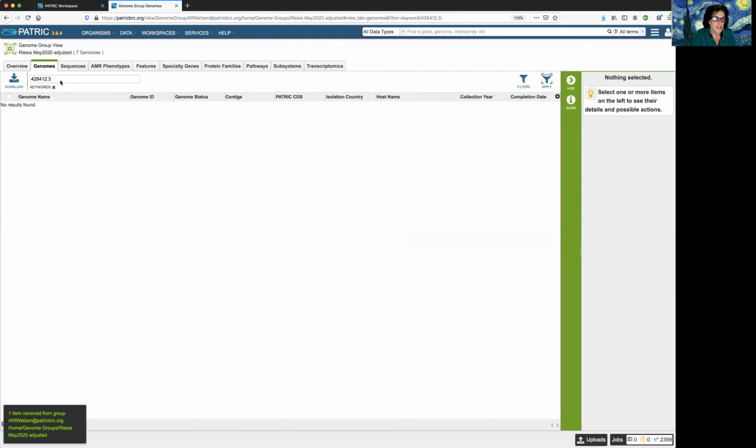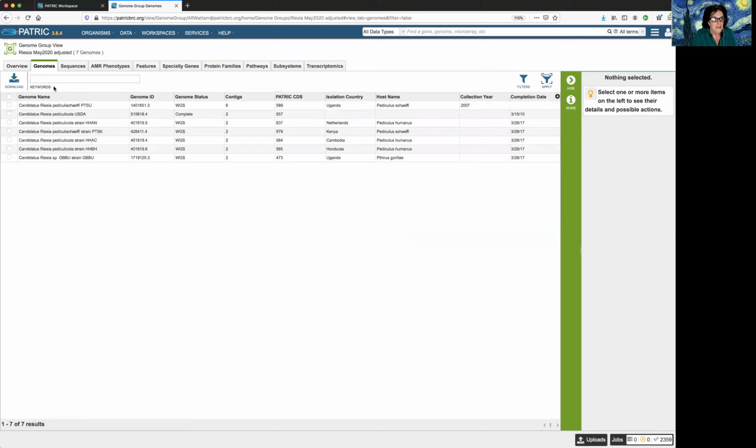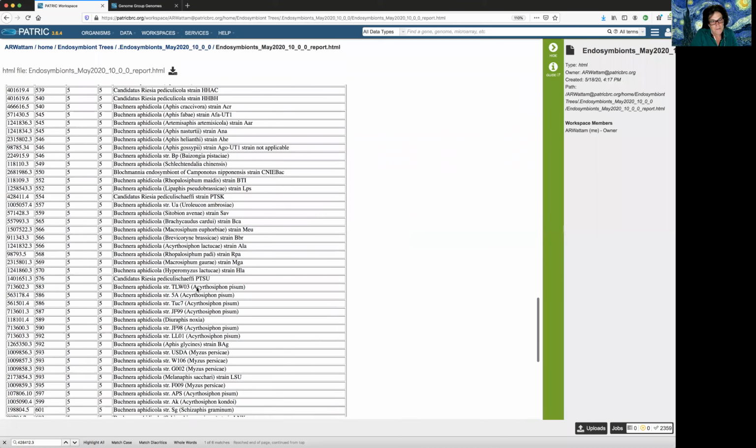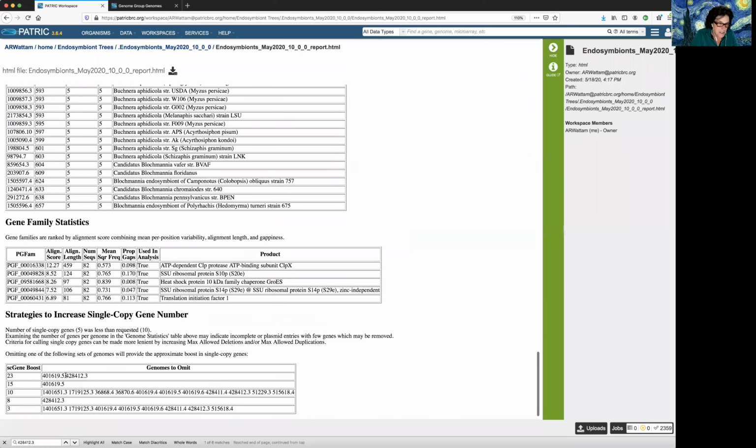And it's gone. But let's check to make sure it's gone. We can remove these keywords. And now that beautiful little genome is gone. Who else was the problem? We've got to scroll down. Pardon me for scrolling all the way to the bottom.